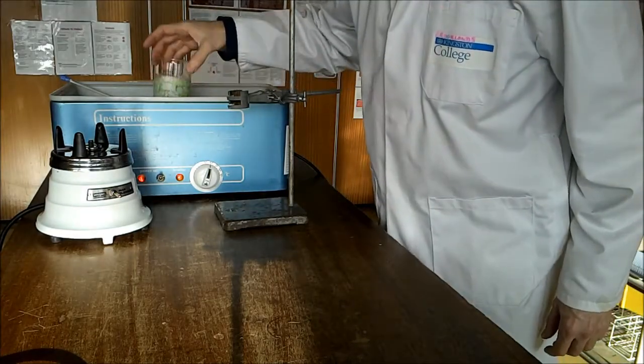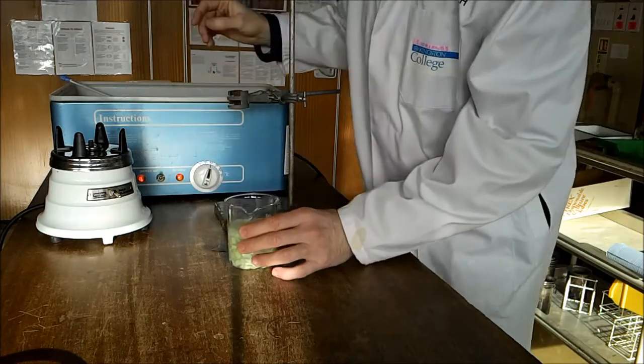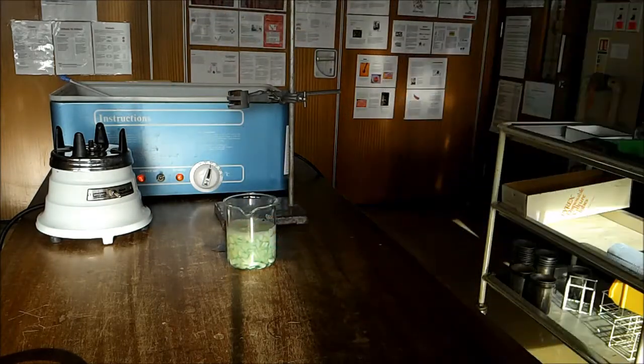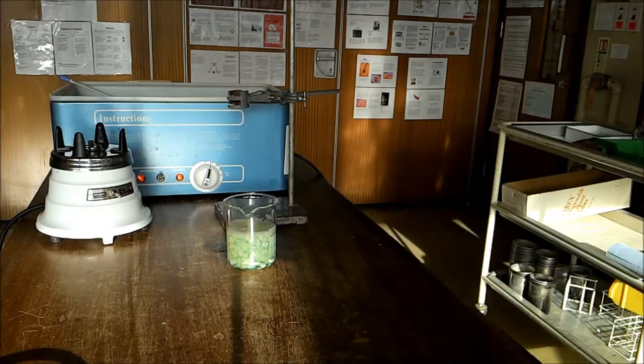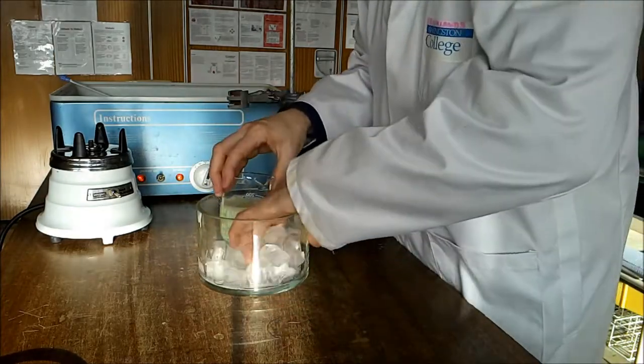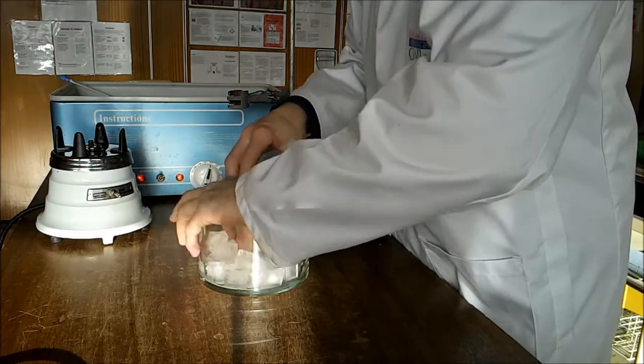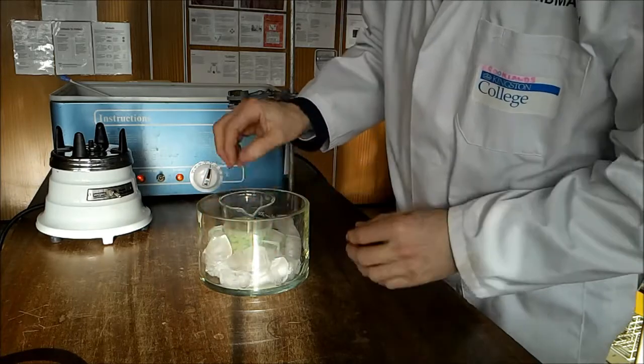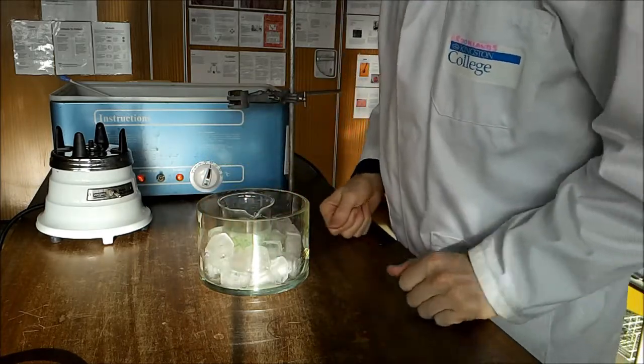After 15 minutes, take out the beaker and cool it on ice for a couple of minutes.